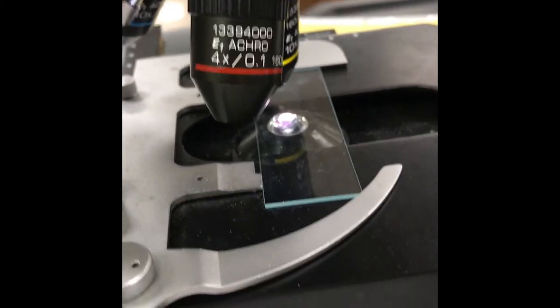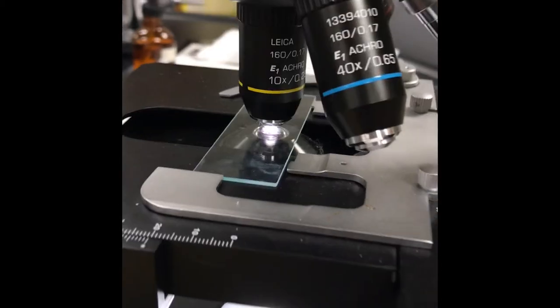Now I need to wait two to three minutes. After waiting, I have them focused one more time. We're using 10x, and they have definitely plasmolyzed.